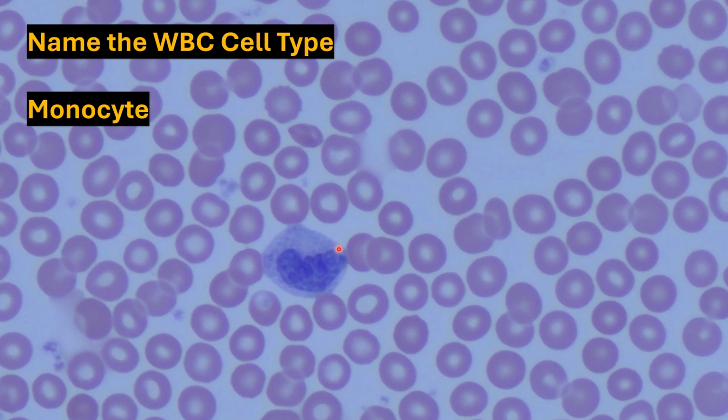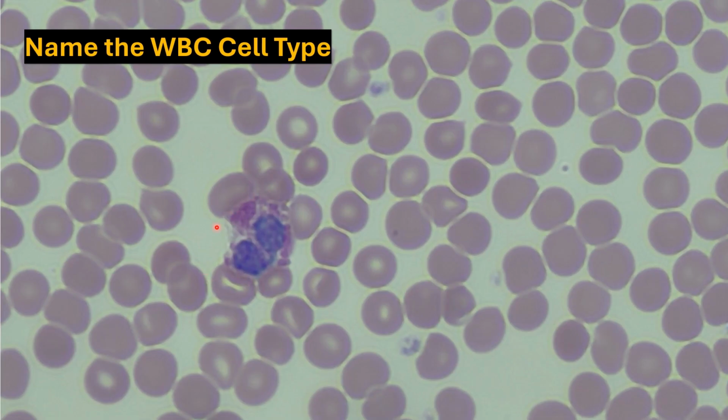The next 2 are granulocytes, and the granules are a bit more apparent. The color of this one should stand out immediately to you. The granules here stain more acidic, so with that alone you should recognize this one as an eosinophil because of its bright pink appearance. Now it does have a bilobed nucleus with a small little bridge right here that connects the 2 lobes together, and it kind of looks like an alien face. This is our EAT, or the second least common leukocyte from our mnemonic, never let monkeys eat bananas.